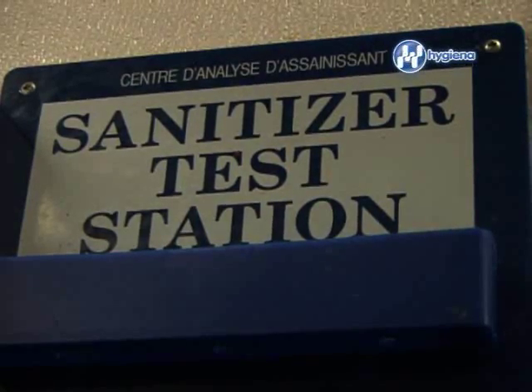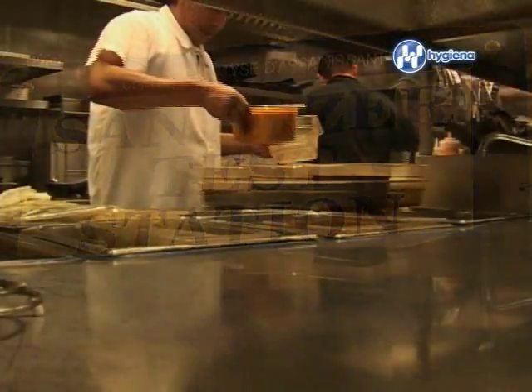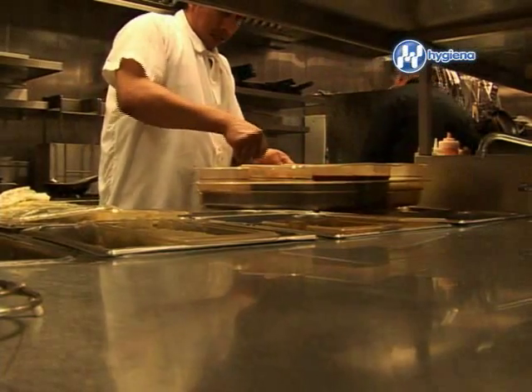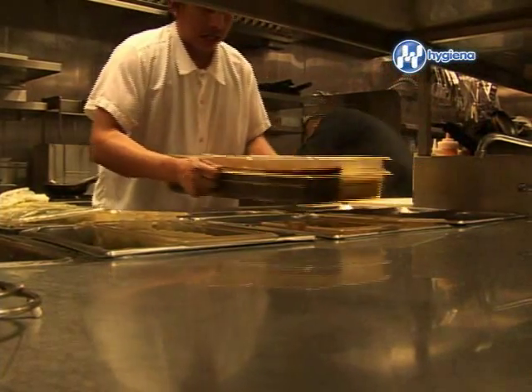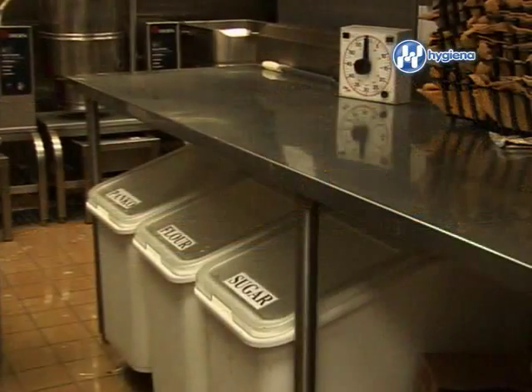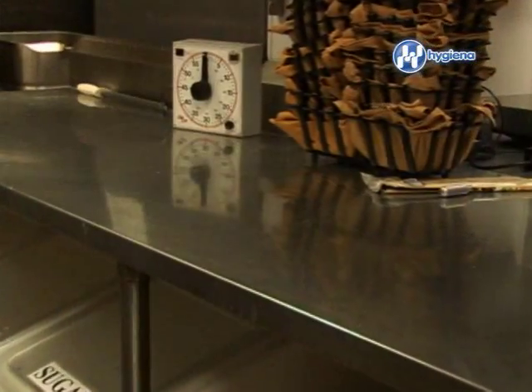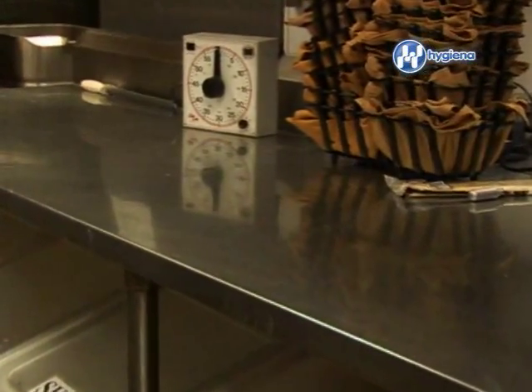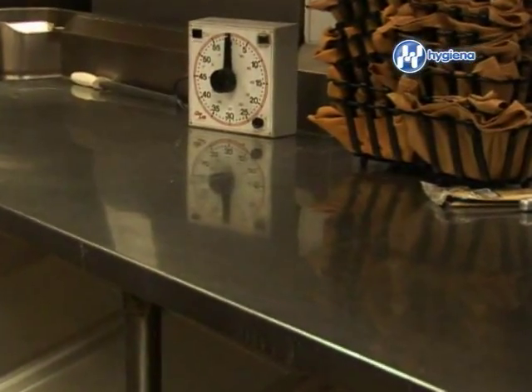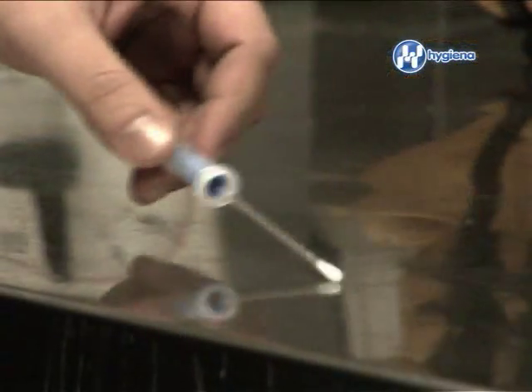Each facility has its own standards for sanitation. Depending on what is being produced, some establishments require a more sanitary environment to ensure a safe product for consumers. By setting thresholds, you are creating a range that gives you a reading of how clean or dirty the work environment is.